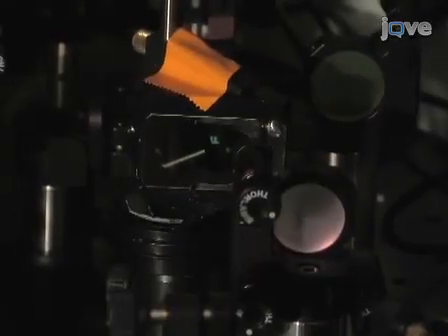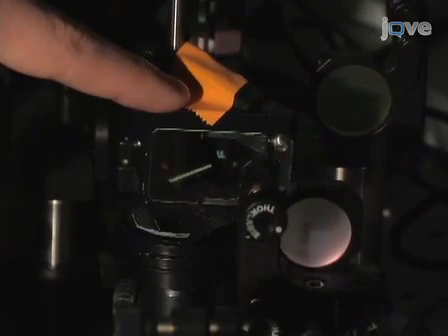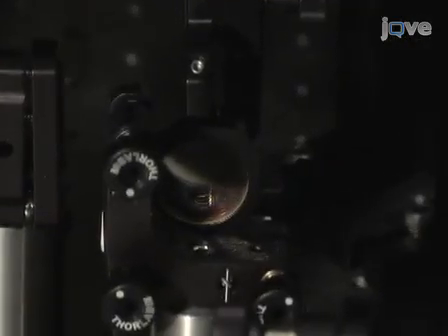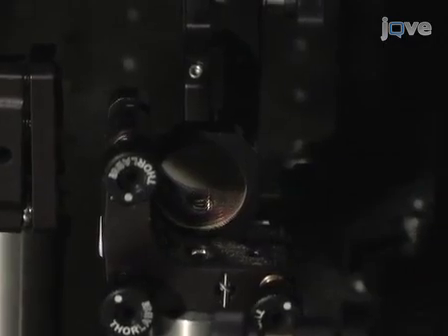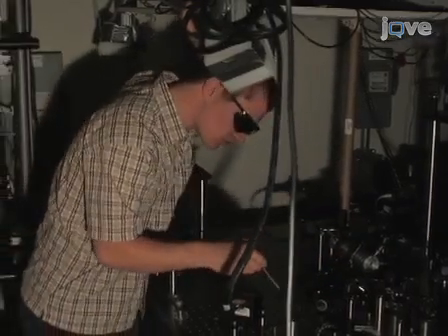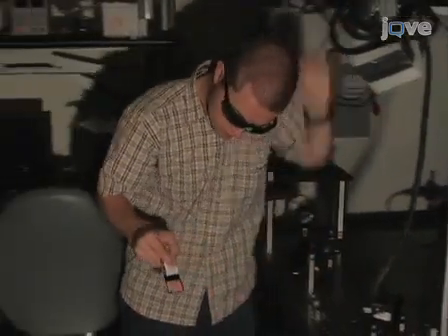Dichroic mirrors are used to first combine the beams from the two OPOs and then the 1064 nanometer beam. Care must be taken to ensure that the beams are precisely overlapped in space. This can be verified by comparing the overlap of the beams within a few centimeters of the dichroic mirror with those approximately 1 meter from the dichroic mirror.